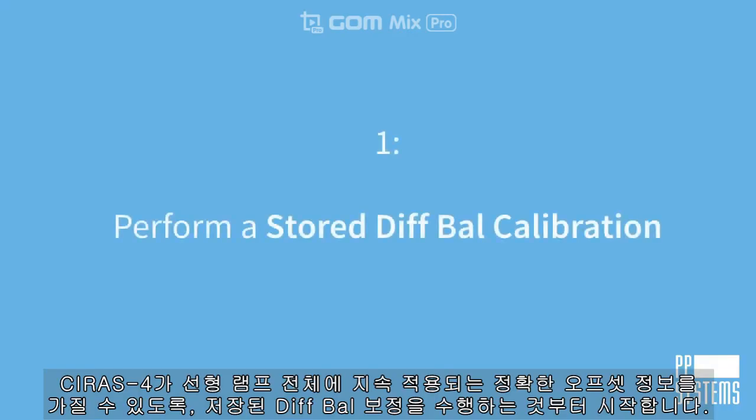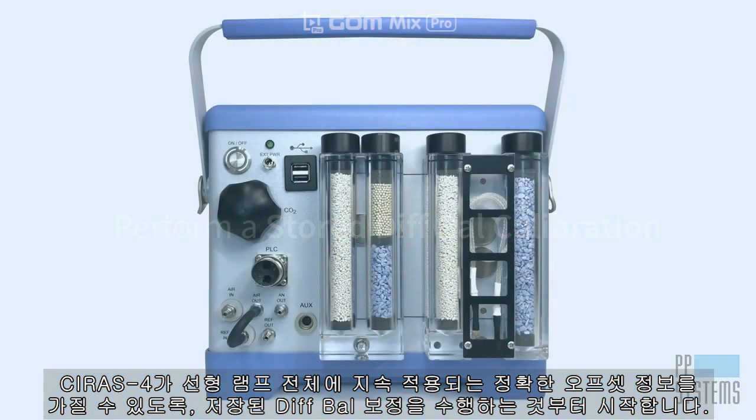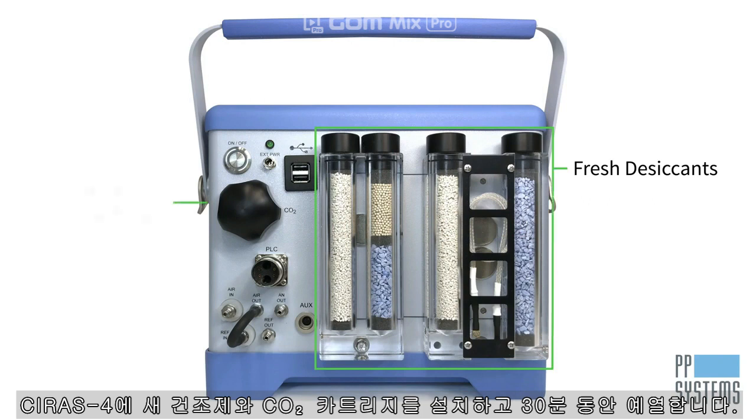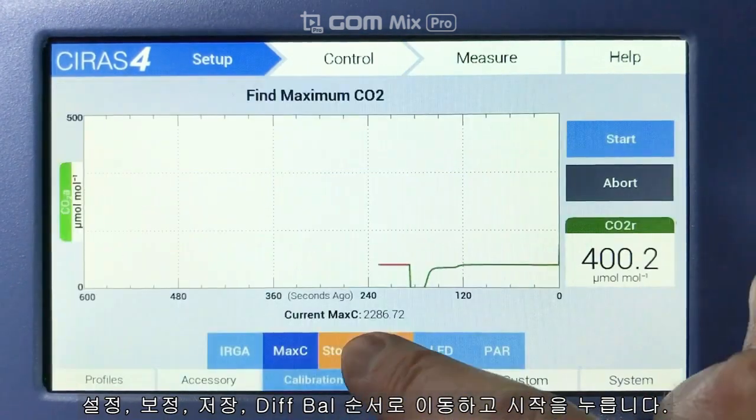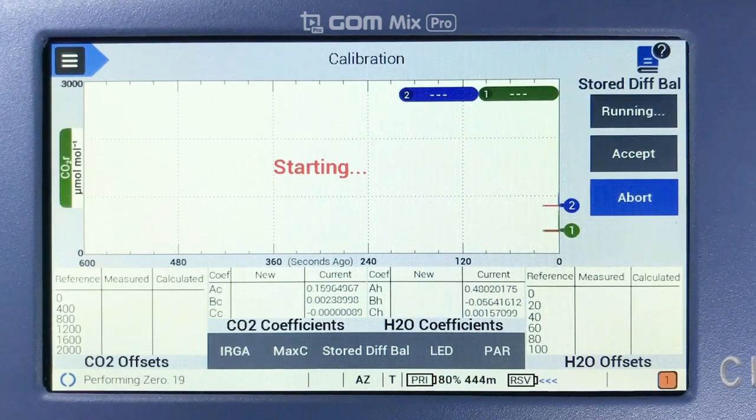We begin by performing a stored Diff calibration to allow the CIRAS-4 to have accurate offset information applied continuously throughout the linear ramp. Install fresh desiccants and a new CO2 cartridge in the CIRAS-4 and allow it to warm up for 30 minutes. Navigate to Setup, Calibration, Stored Diff and tap Start.